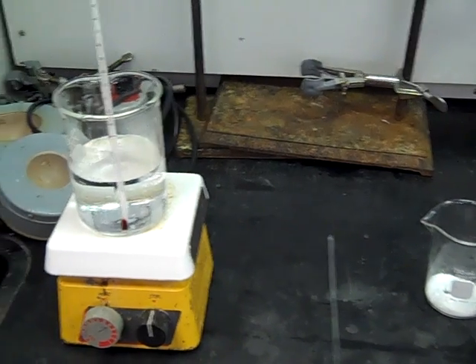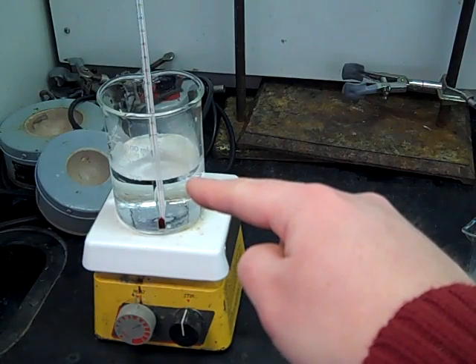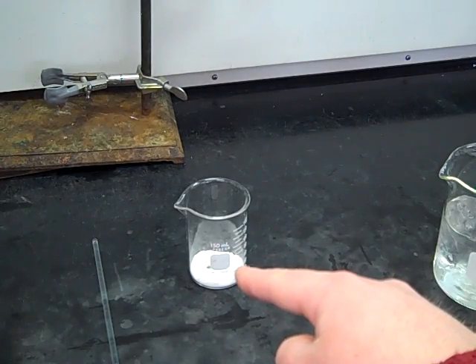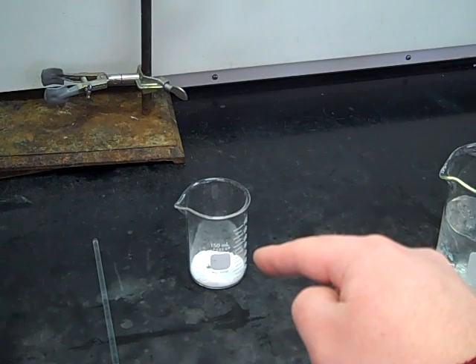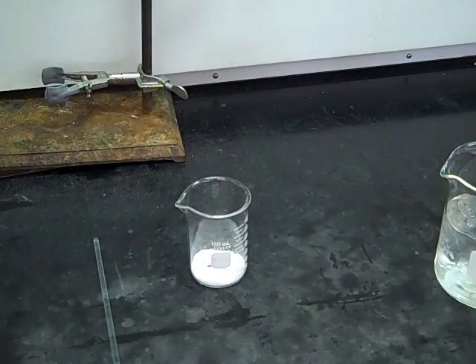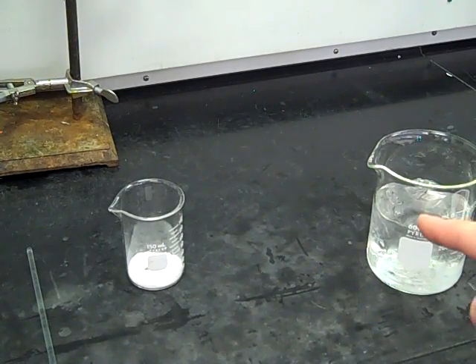So what you're going to need, first of all, is a hot plate — that's warming up some water that you can see there — and possibly a stir rod. That's our unknown, the organic solid that we want to purify. In there may be some different impurities, possibly in this experiment sucrose and aspirin, but in an organic reaction that might be side products or starting materials. And then finally an ice bath over there on the right.